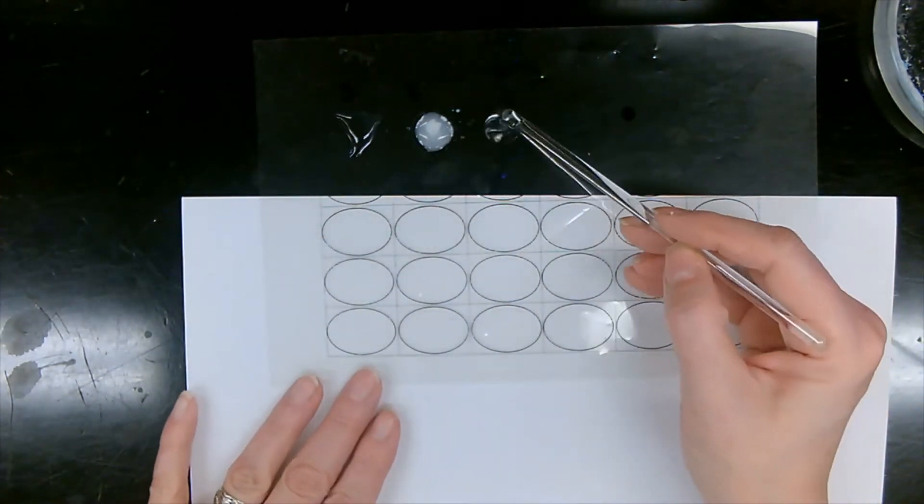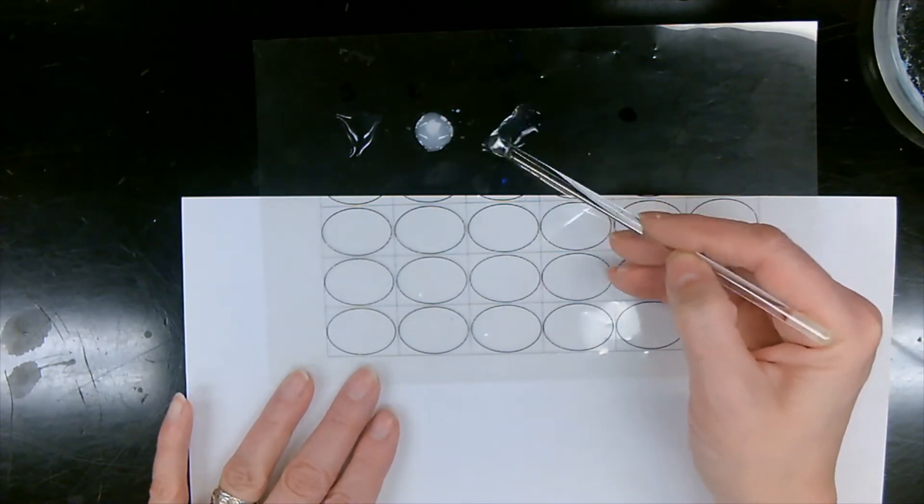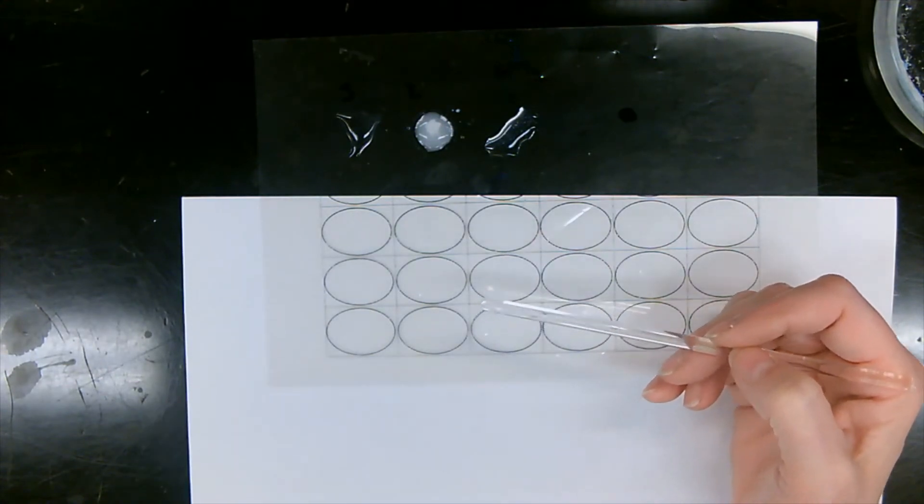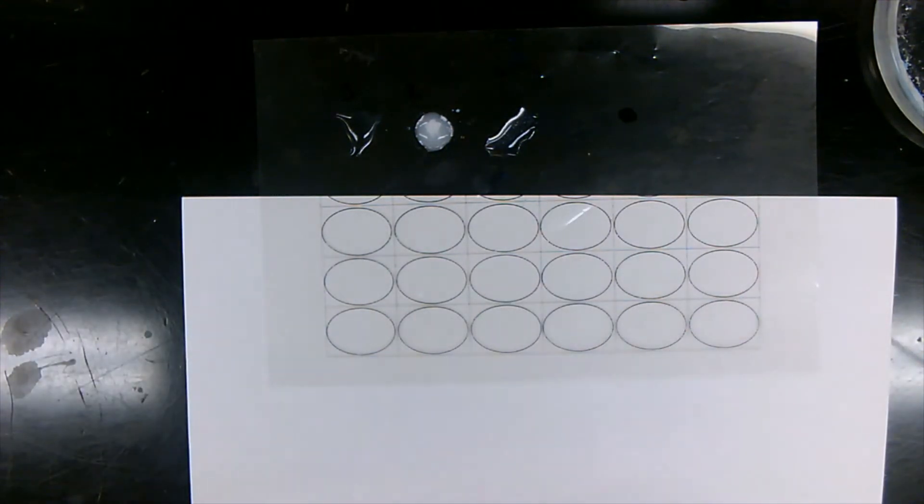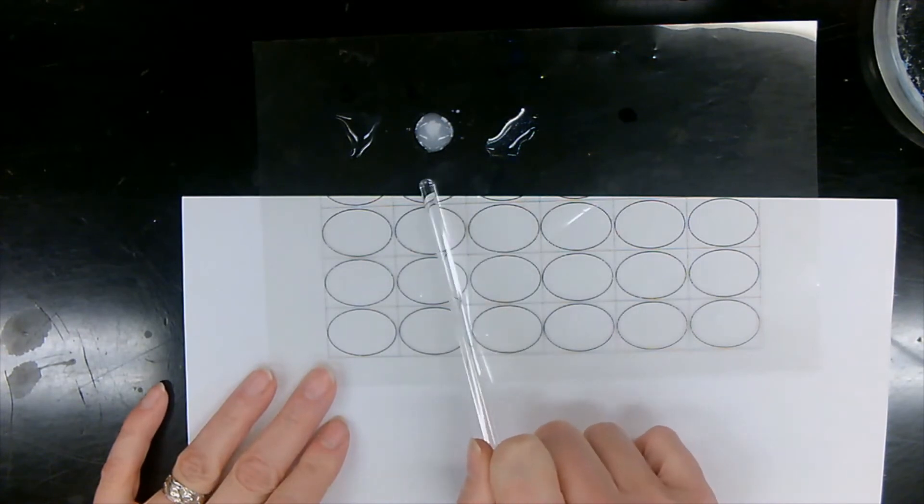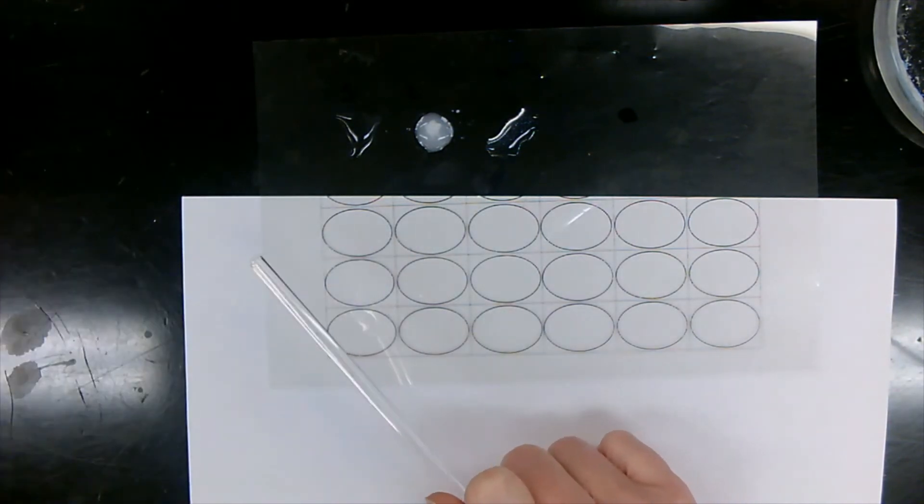Unknown L. Just clear, and silver nitrate. Still clear. All right, so J and L, these ones stay clear, no precipitate. K has a precipitate. Let's make sure we have all this written down.